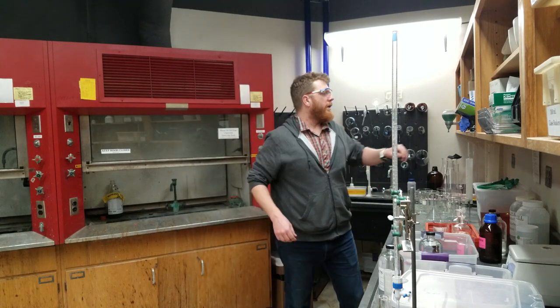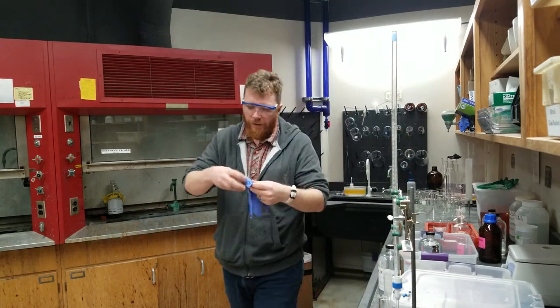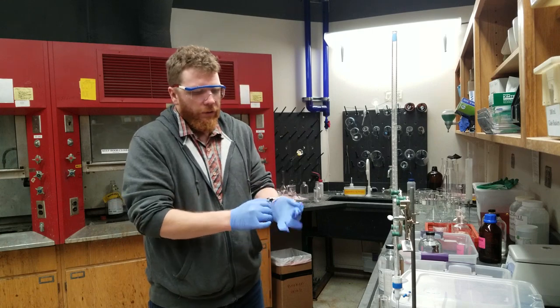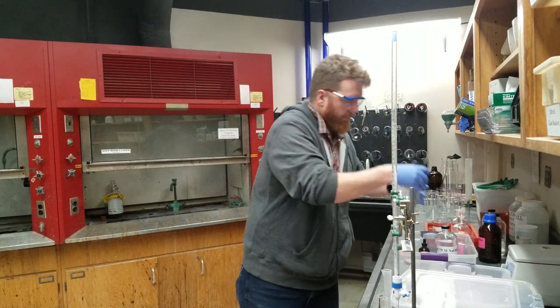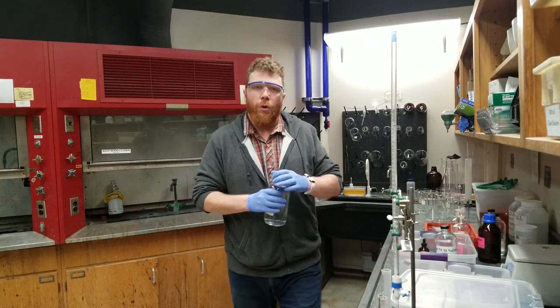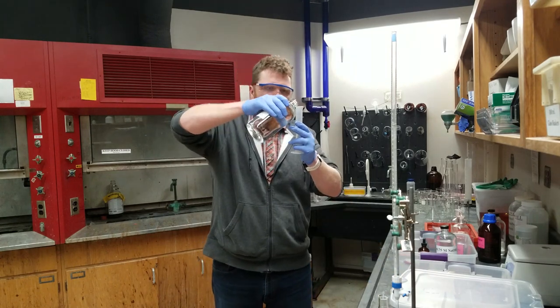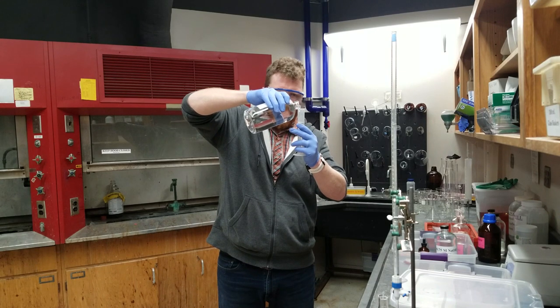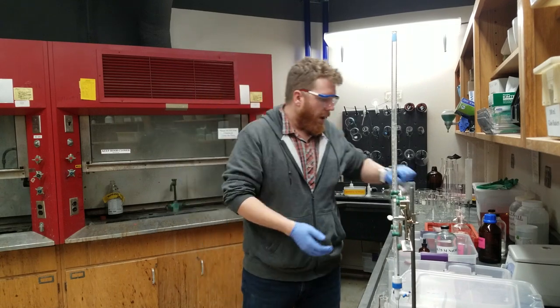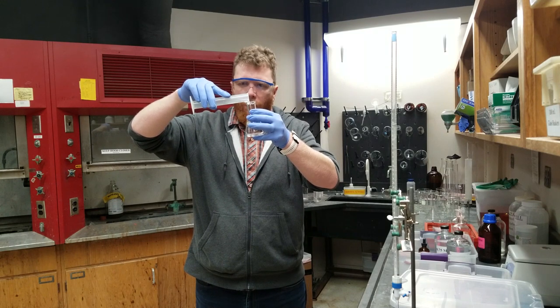Get a pair of gloves, because anytime you're working with an acid or a base you want to keep protecting yourself — I'm wearing nitrile gloves. I'm going to transfer the unknown acid. It is hydrochloric acid, HCl. The concentration, however, I'm not going to tell you — that is for you to figure out. Transfer 50 milliliters of the acid into your graduated cylinder, and then transfer that into your 125 milliliter Erlenmeyer flask. Your IA will prepare the solution into a smaller bottle for you.